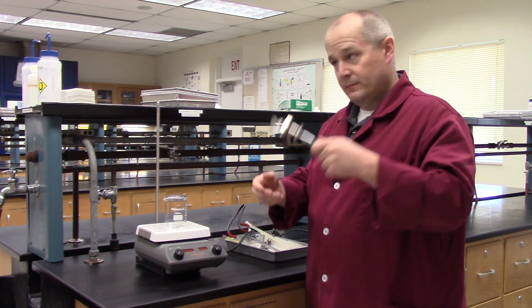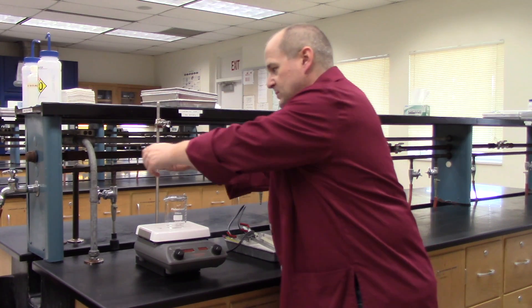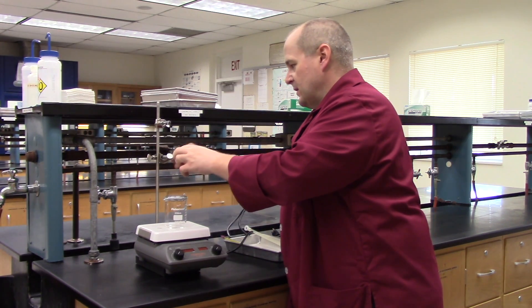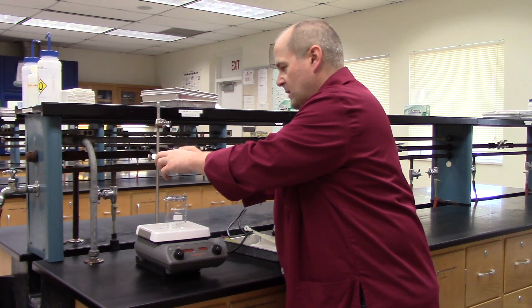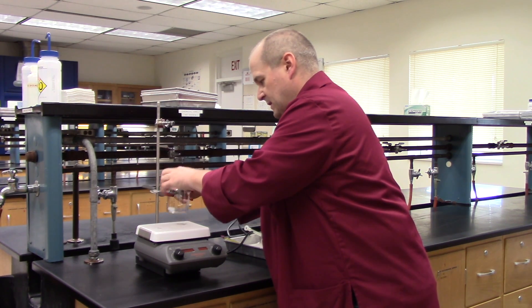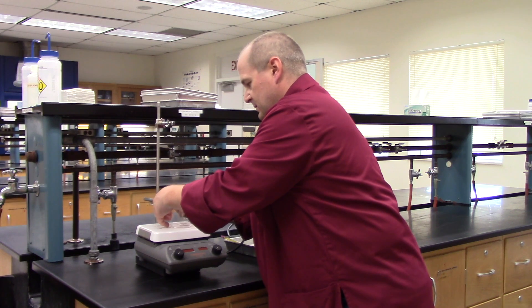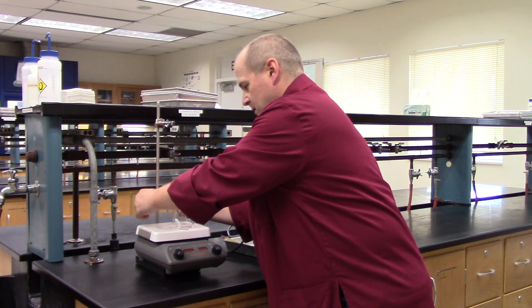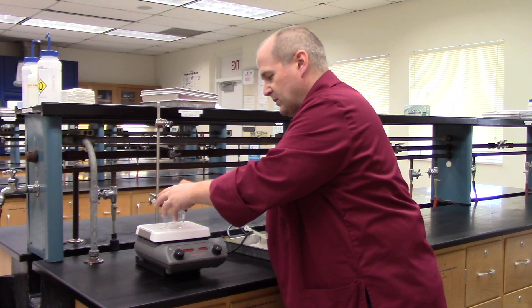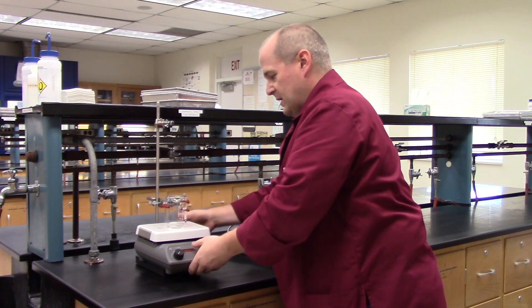Put the thermometer clamp onto the clamp stand. Put the clamp holder onto the clamp stand. Using the three prong clamp, lower it down so you can clamp the beaker. You may have to adjust the clamps a little to make this work, but it does work. Try to adjust it so that the beaker sits nicely on top of the hot plate — try to center it as best you can. The beaker should be more or less in the center of the hot plate.